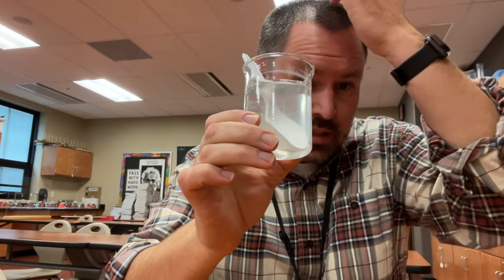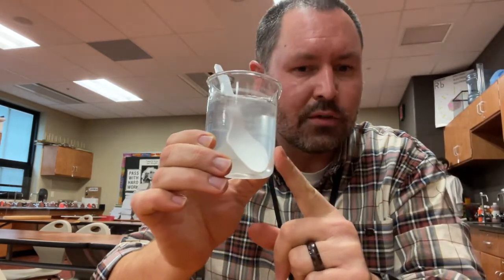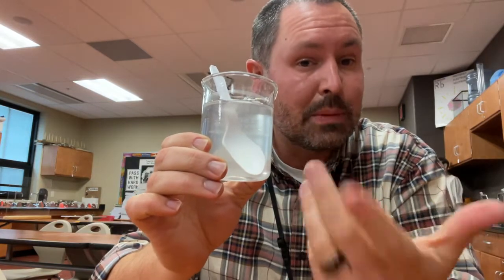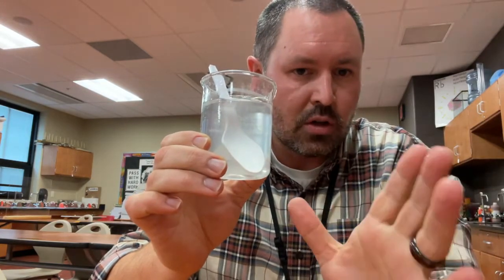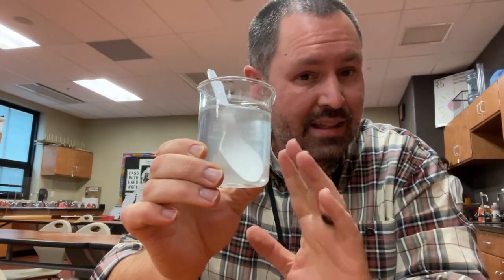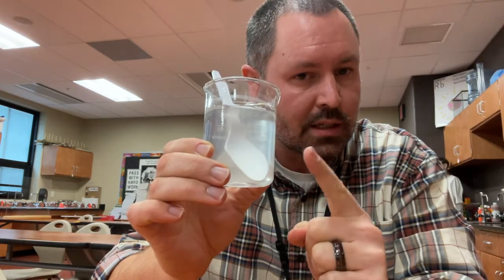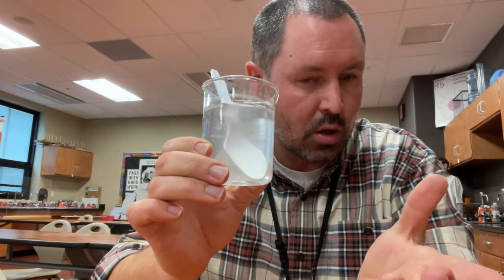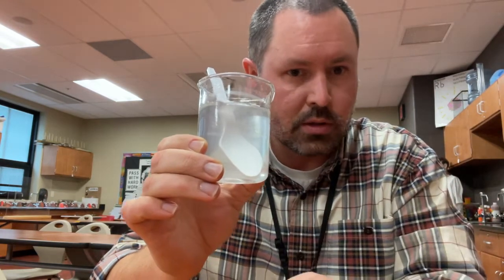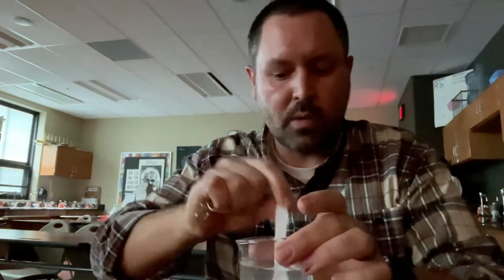That ingredient that's in the salt actually makes this cloudy. Salt water itself should be uncloudy. It should be completely clear. So when it comes to your appearance or observations for the salt water, this does not show it quite right, but it should be completely and 100% clear. Kind of like ocean water, except without the pollution and stuff like that. So this should be completely clear. This should be the salt water. Let's go to the salt water now.